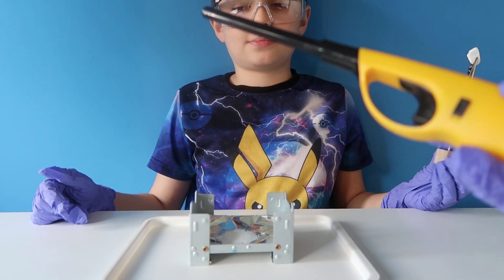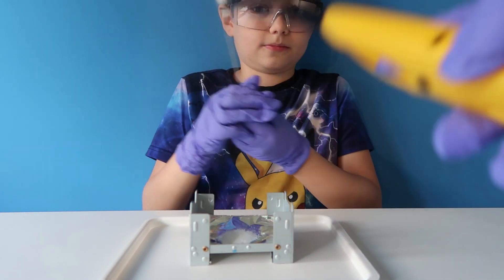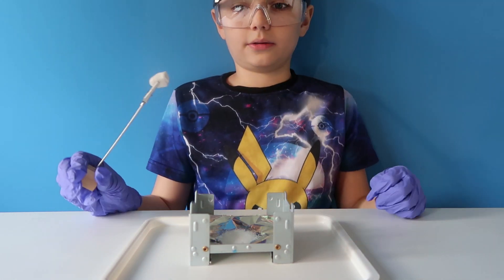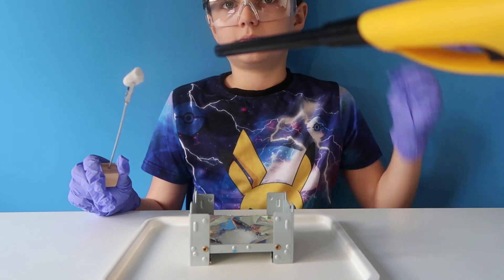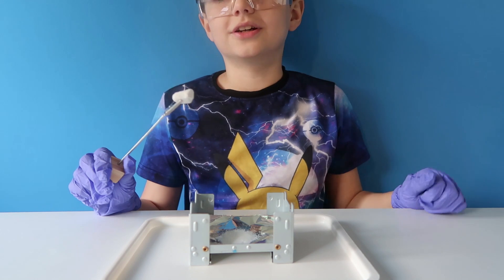After 15 seconds we're going to put this in the flame for 15 seconds. So as soon as it's lit we're going to put the marble in the flame for 15 seconds, and then it's going to hold on to some of that energy inside the marble, and the marble's going to glow. Awesome — okay, you ready?